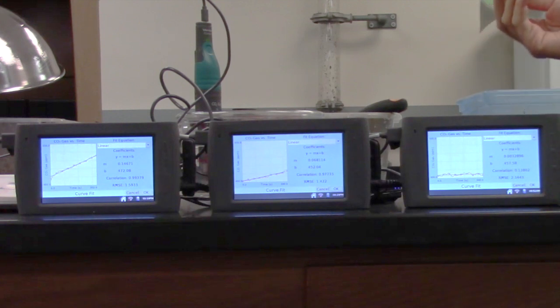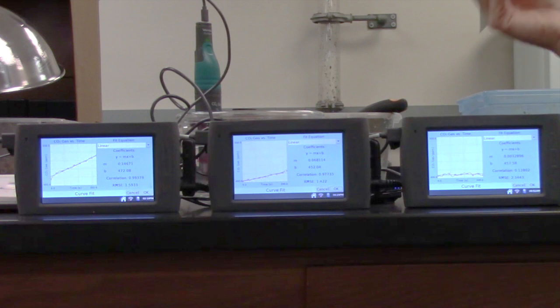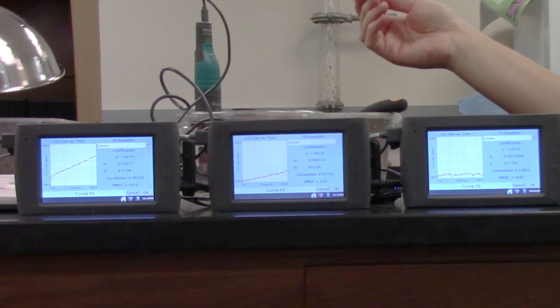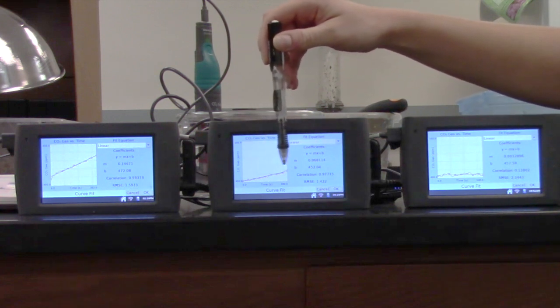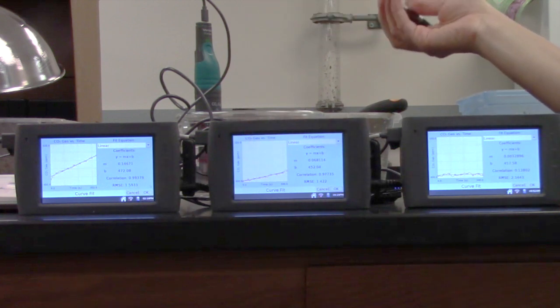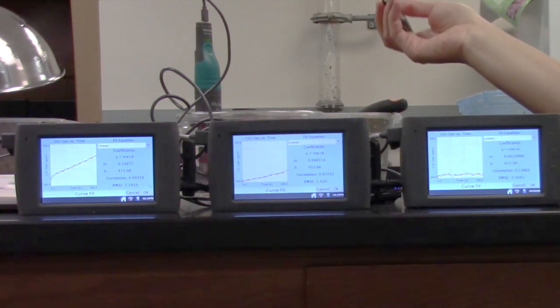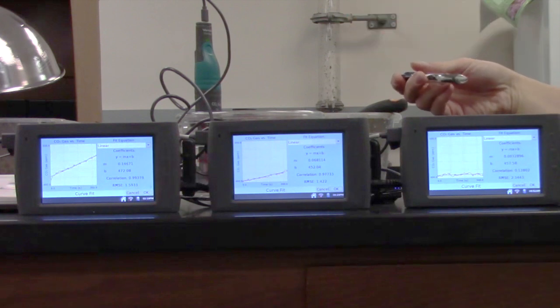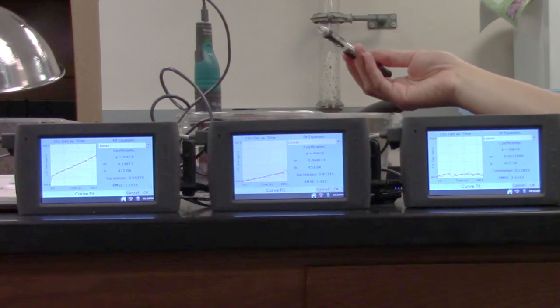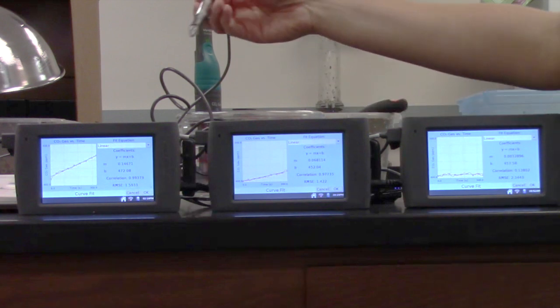This isn't surprising since we didn't really change much to the soil. It's just cool, dry, just how it's been. So this was as expected. For the next treatment, our cool and wet soil, you can see there's definitely a little more of a slope on the graph, with a little bit of an increase in CO2 parts per million. This slope ended up being 0.06, so a little bit bigger than our cool and dry soil, but still not a huge increase. Again, this is what we expected. We changed one variable, added some water, so it's a little different, but not drastically.